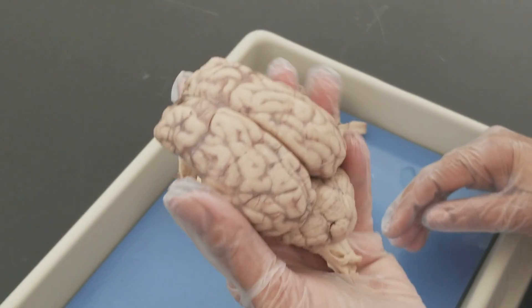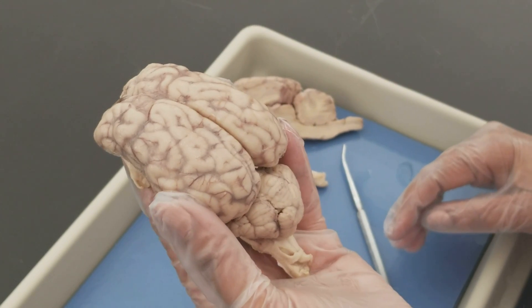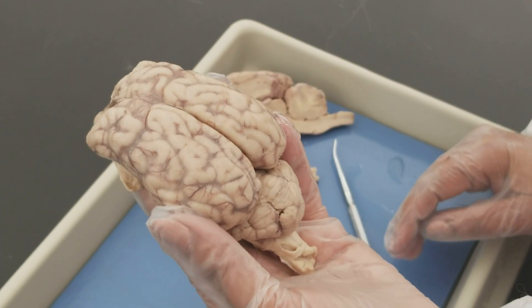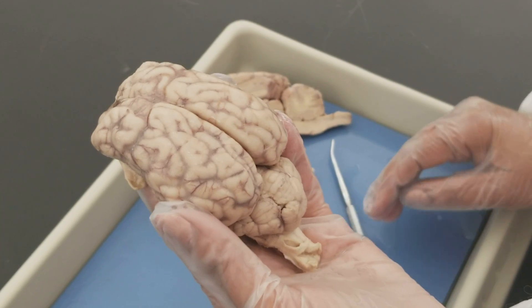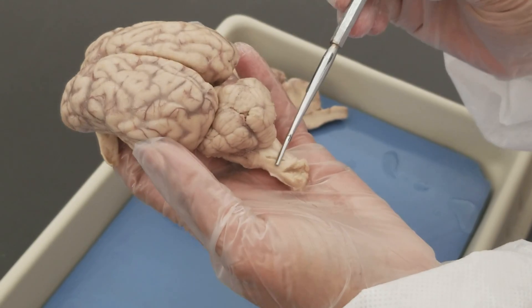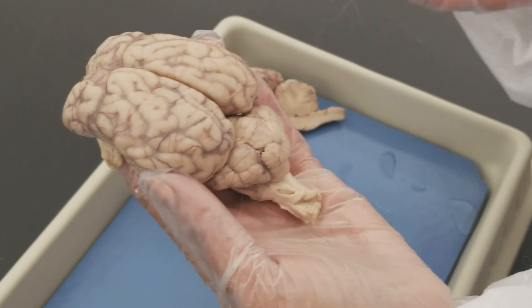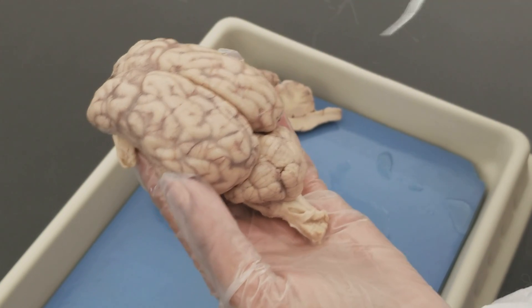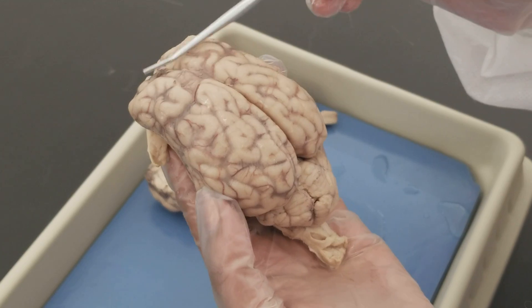Let us first try to see the major structures without cutting the brain. The brain has four main regions: the cerebrum, the cerebellum, the brainstem, and the diencephalon, which is the central core of the brain that you cannot see without cutting the brain. We'll start with the cerebrum.